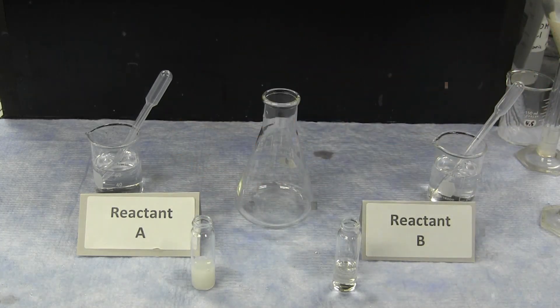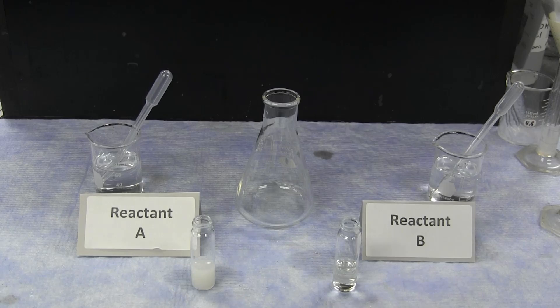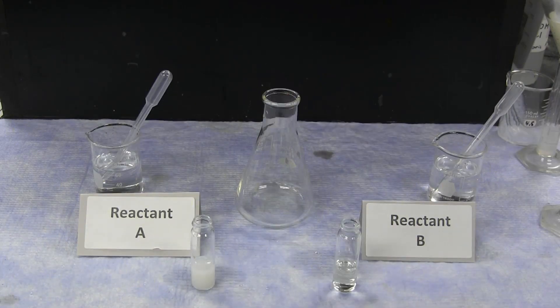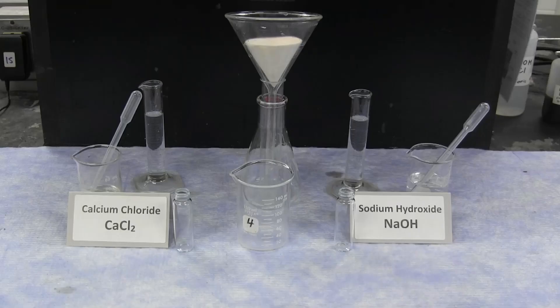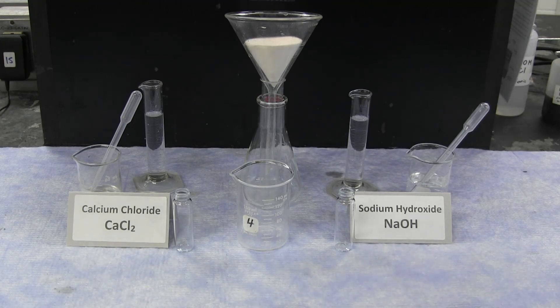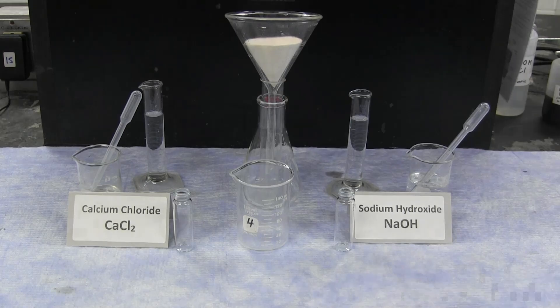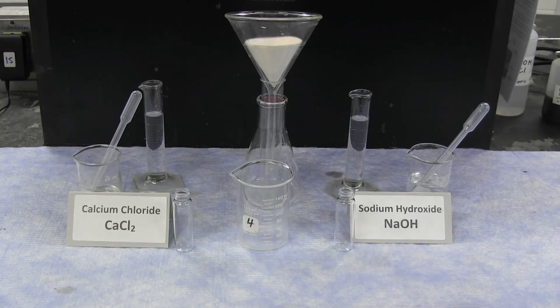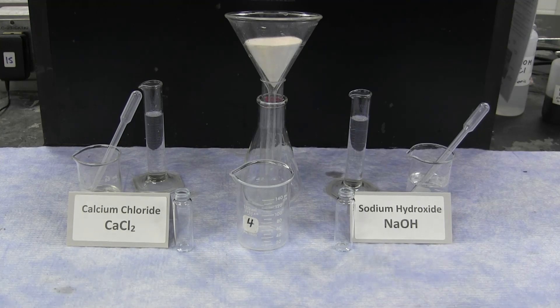Based on these observations, you can determine in the original reaction what is the identity of the limiting reactant. The second reaction setup is specifically a reaction between calcium chloride and sodium hydroxide. The concentrations of these two solutions can be found in your unknown file.